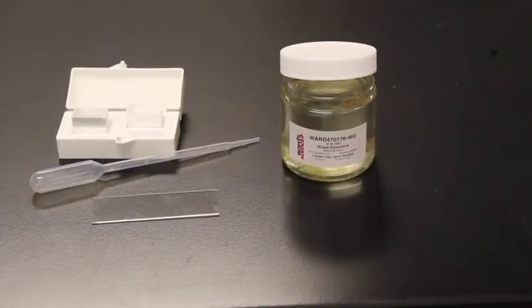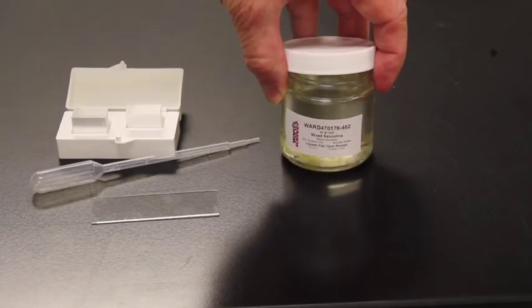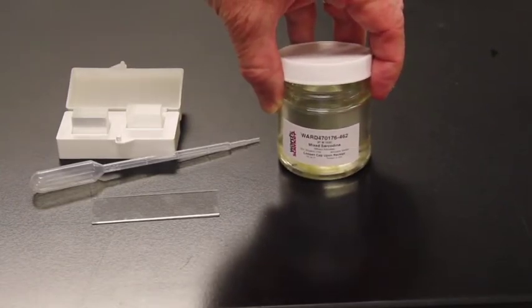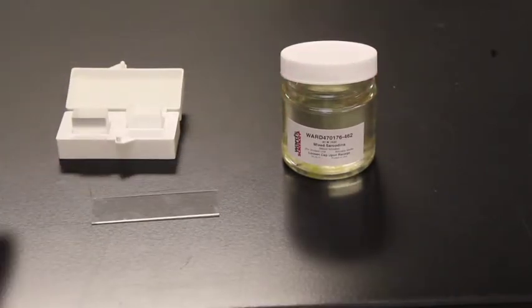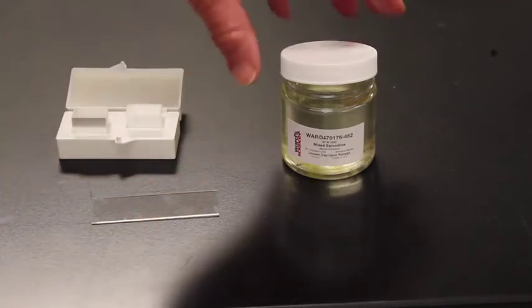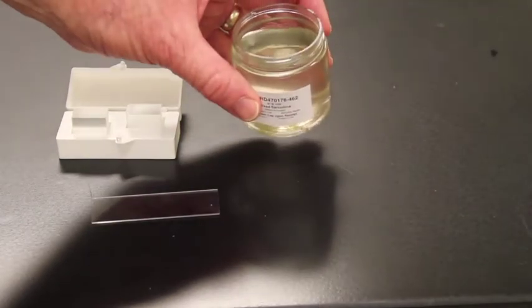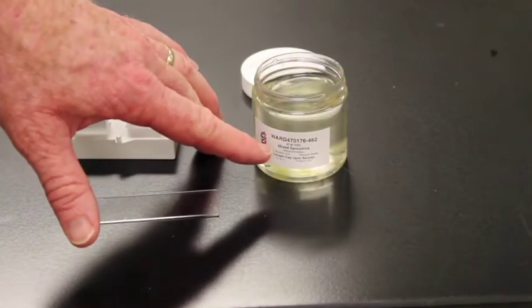The first technique I will show you is how to make a wet mount. So we have a culture here. This culture is of mixed amoeba. The first cells we're going to look at are amoeboid cells, which are really cool cells. We have cover slips here and a microscope slide that has all been cleaned off. So I'm going to take the lid off of this. Key thing about an amoeba slide is that the amoeba are all in the bottom.